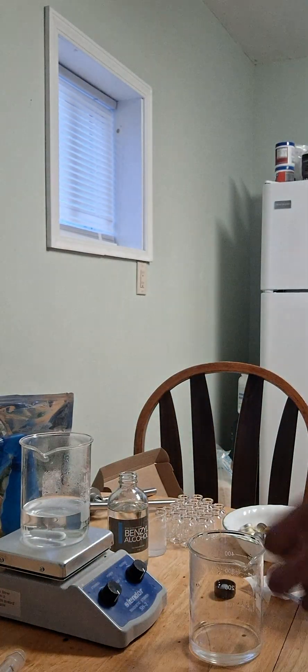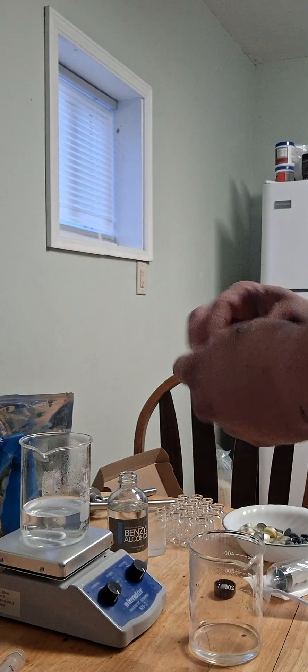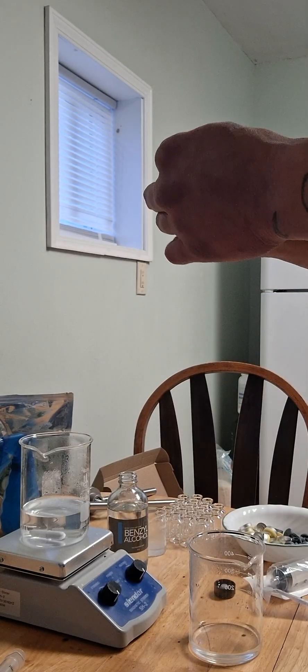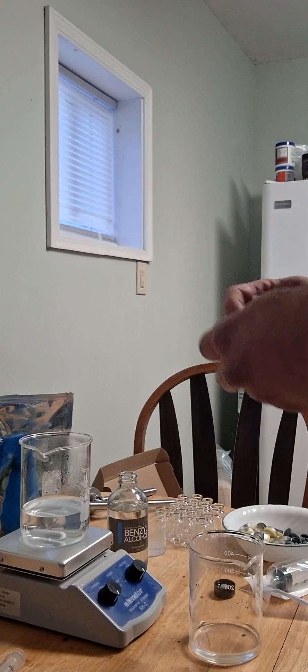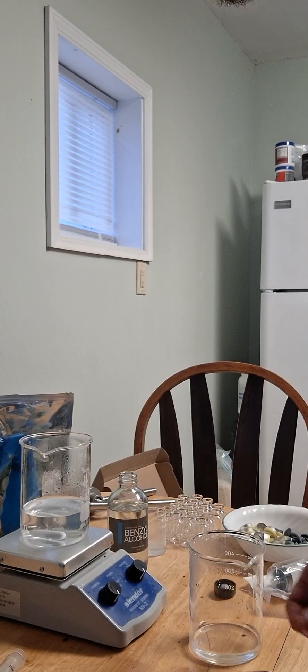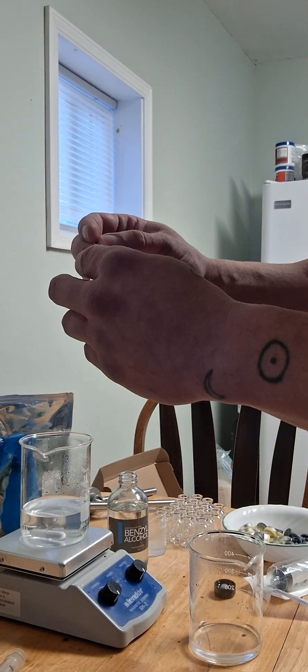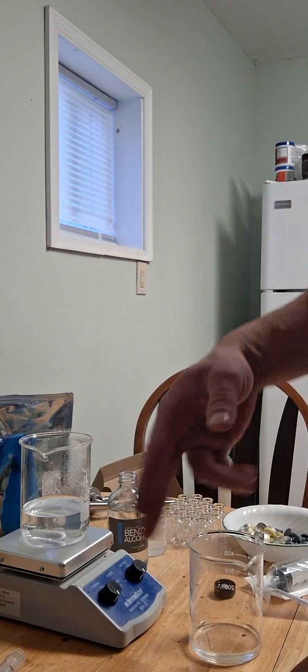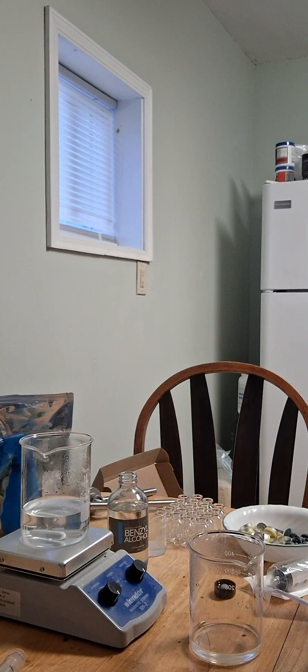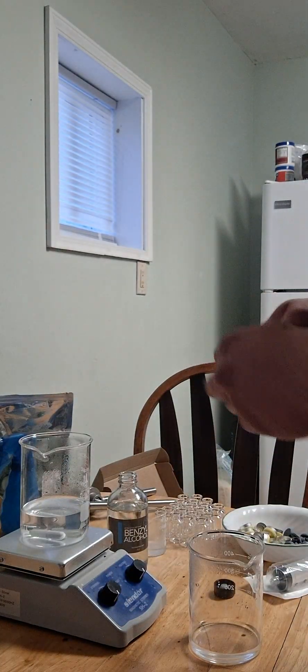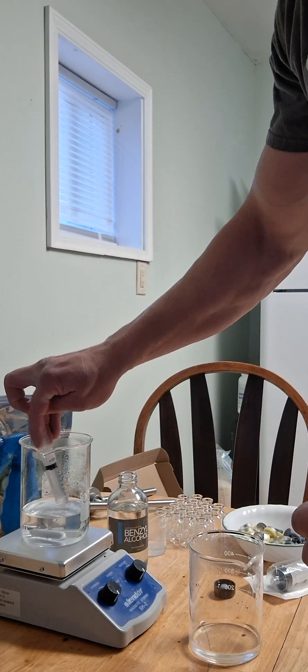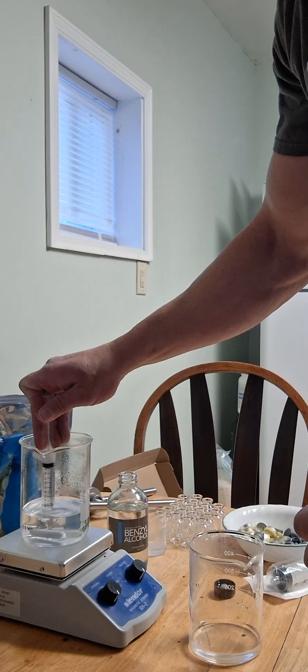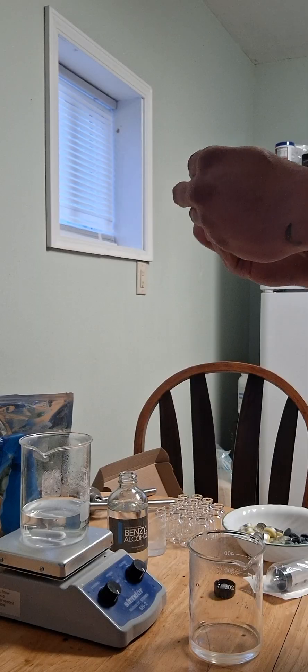Jesus Christ, I'm so nervous doing this. So anyway, how you would do a personal use vial is you would take one syringe tip and you would puncture. This will act to allow it to breathe, like for the exit when you put water in to let the pressure escape from it. So what you would do, you would suck up 10 ml of water and put the filter back on.